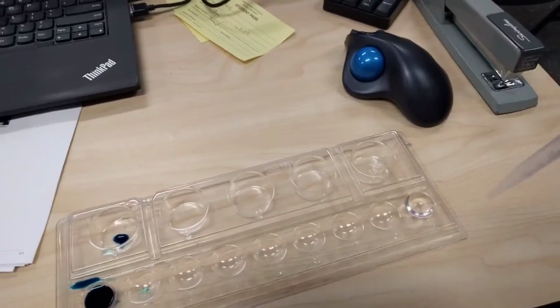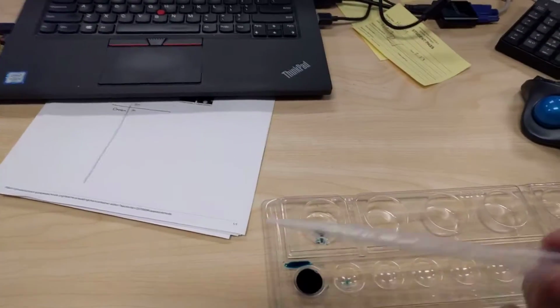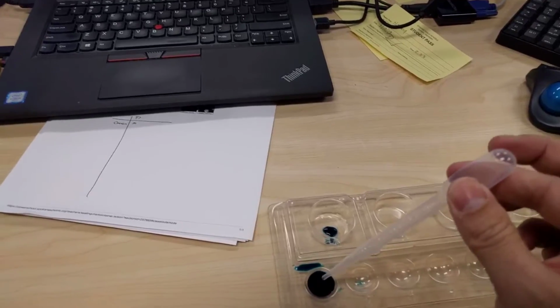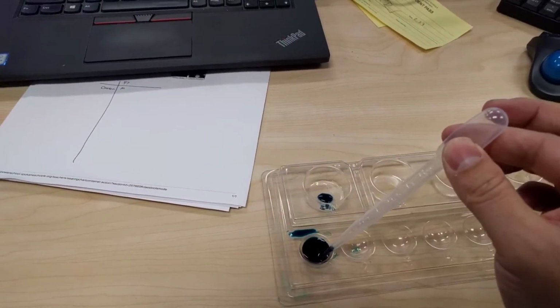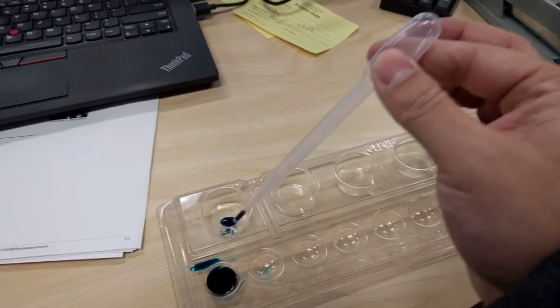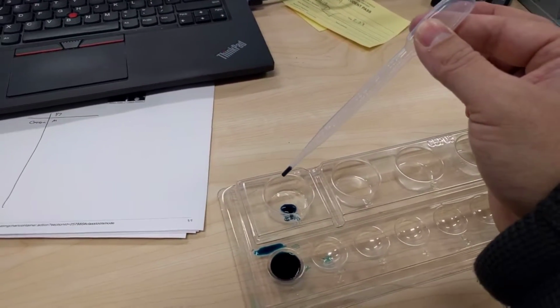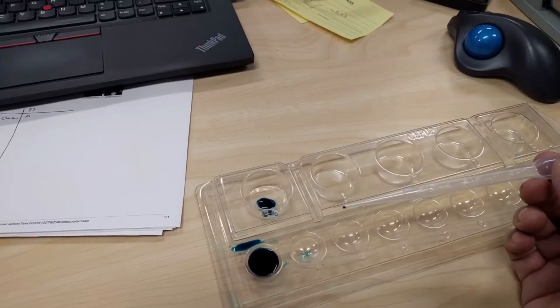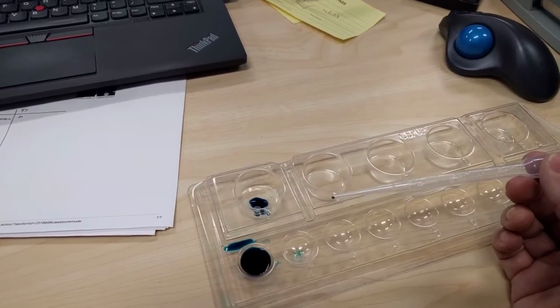Now, to control the amount of liquid up here, I don't have to release it all the way once it's in. So it's like, oh, okay, I got enough. But notice my fingers are still squeezing the bulb here, and there it is. Just a tiny amount. And that's what's going to be dropped onto our slide, is just a drop.